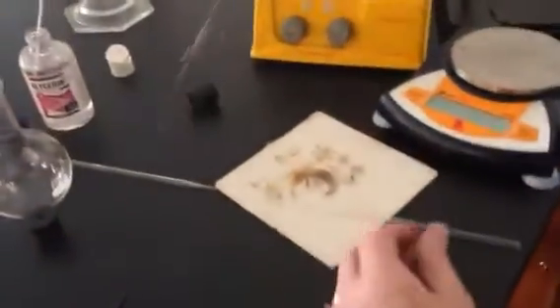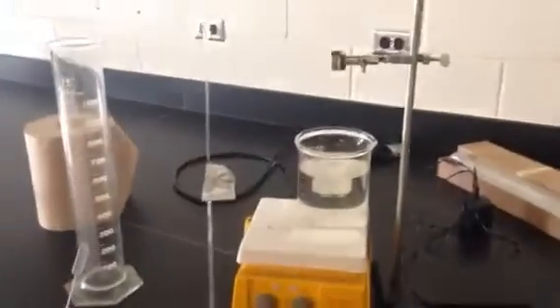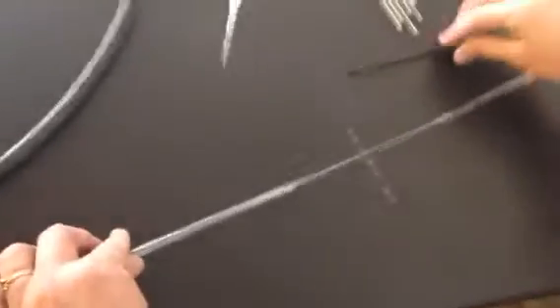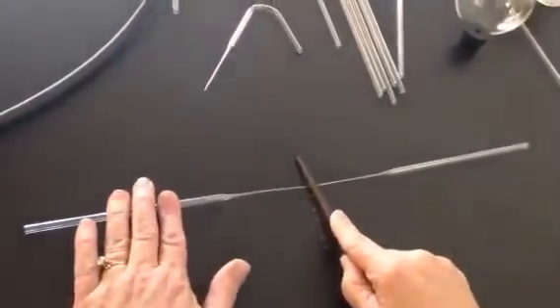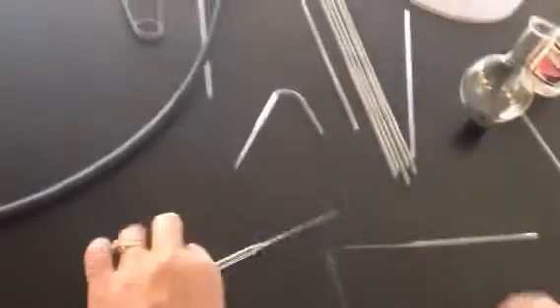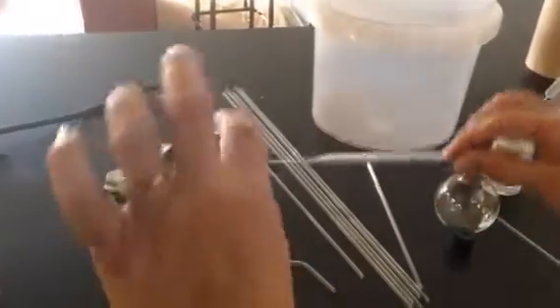And I have another piece prepared that's already been stretched, but it's cool. I'm going to break it kind of down the middle because I need two pieces out of that. I'm going to do that same thing, push on that center, but it's pretty skinny, so it's pretty easy to break. And then I'm going to take the wing tip. You'll have it on the same burner. I've just got it on a different burner.